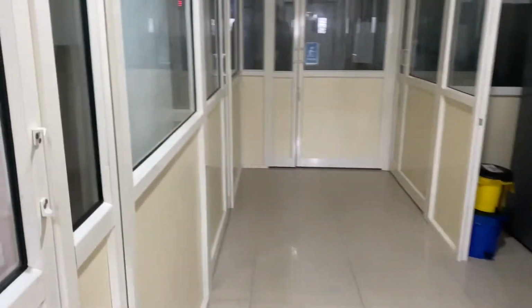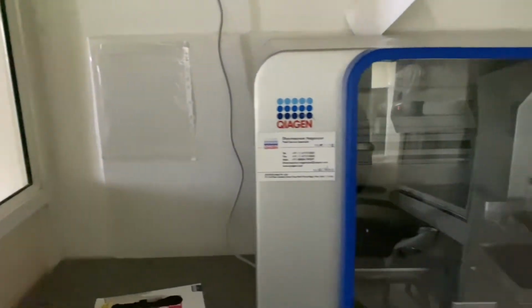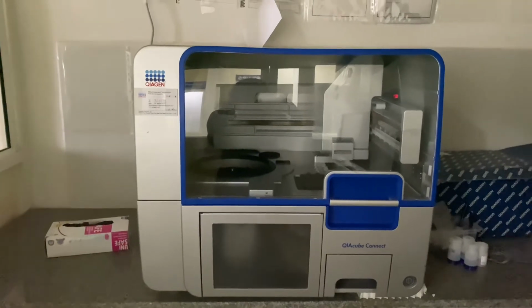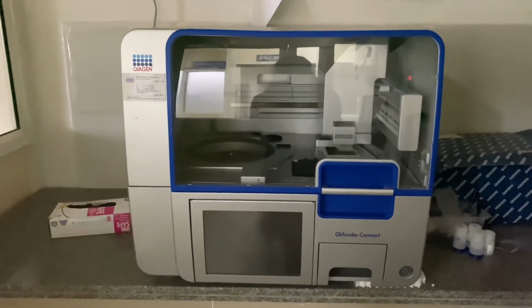Now we are going to the other side, another room. Here, whenever they collect the sample, they have to keep it here. One more technician has to be here, and they will collect the sample and then process it. This is the sample extractor. Whatever we need from the sample or the organism, we can get here. This is again a big process. It depends upon the samples. It will take 1 hour to 2 hours.